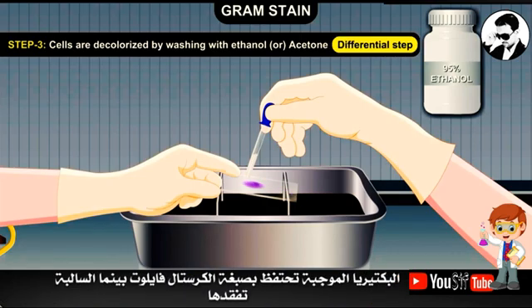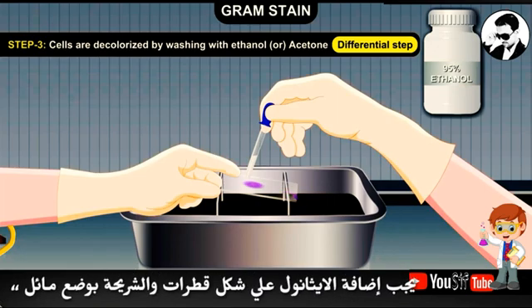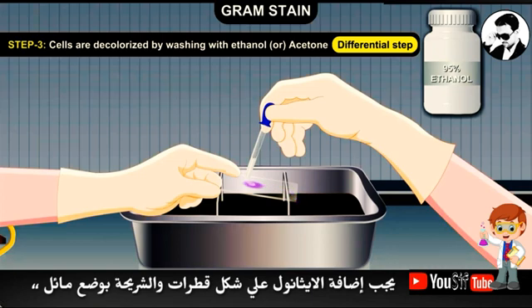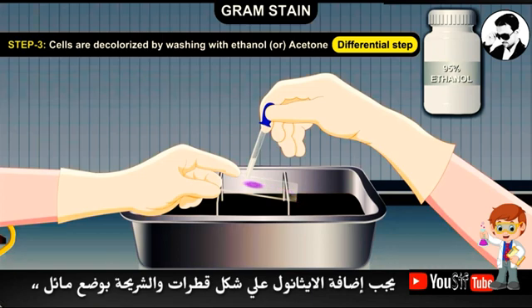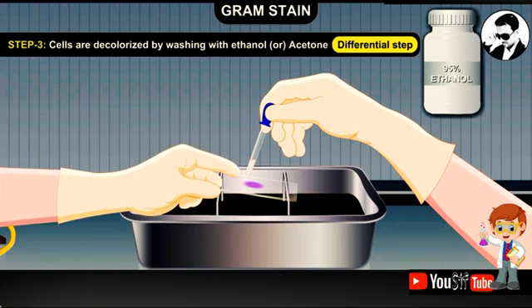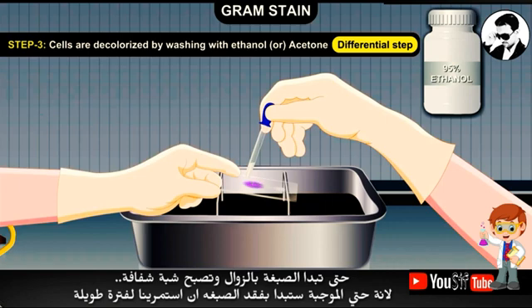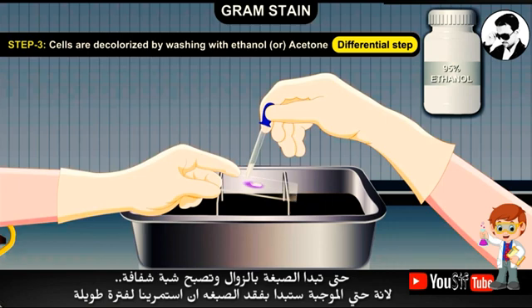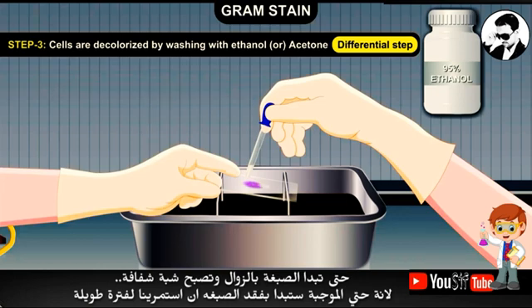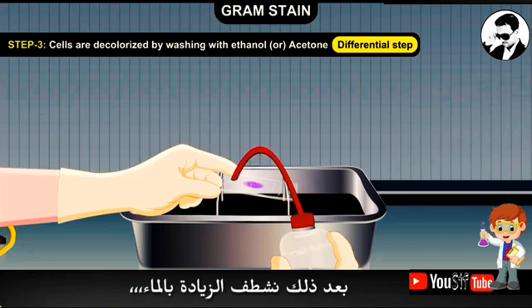The cells are then decolorized by washing with ethanol or acetone. This is the differential step: gram-positive bacteria retain the crystal violet, whereas gram-negative bacteria do not. The ethanol or acetone should be added drop-wise with the slide tilted at an angle, until the drop coming off the edge of the slide just starts to become colorless.